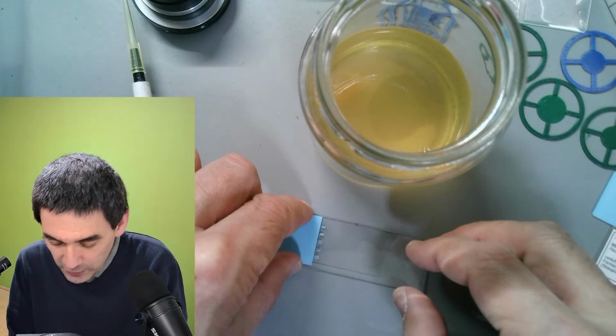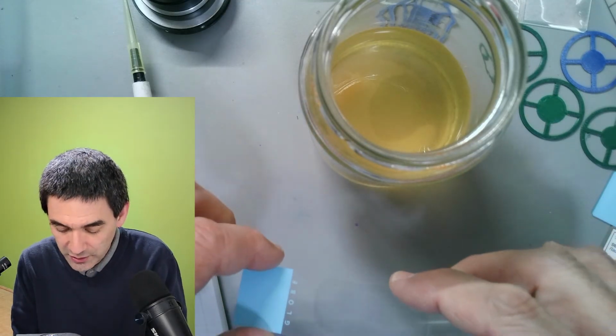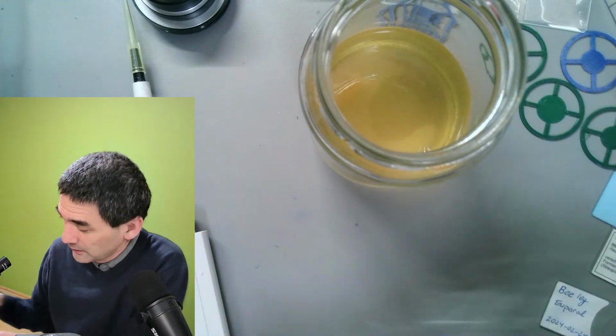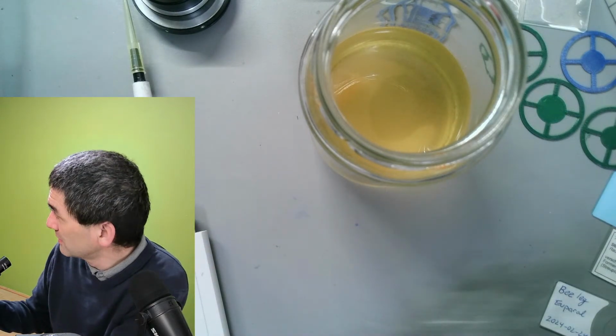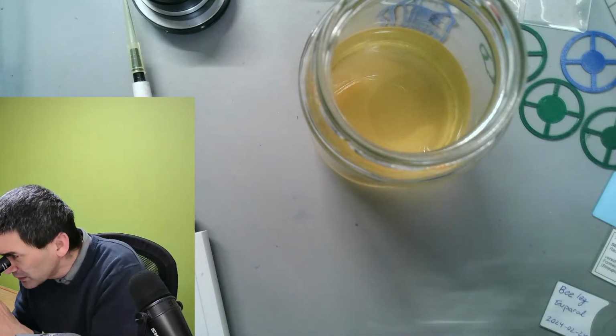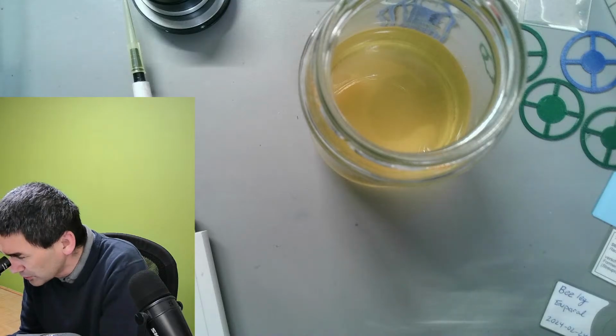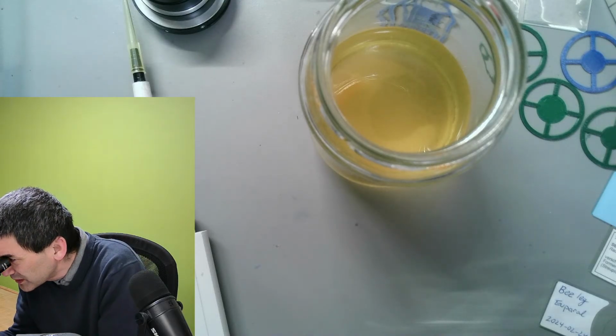I don't know if I caught any. I hope really that I've got some of those worms on here, at least one of them. Let me quickly check through the microscope here. Do I have any worms? Are there any worms visible or not? Let me see. Yeah, got one.